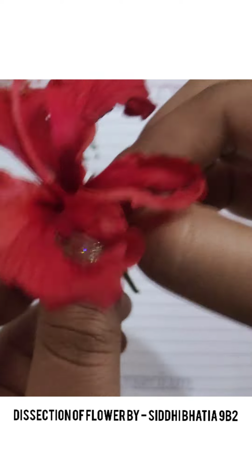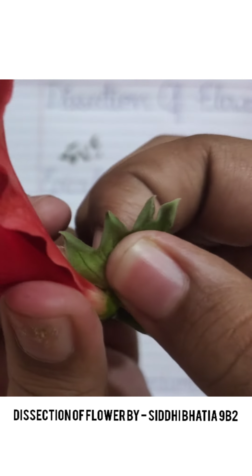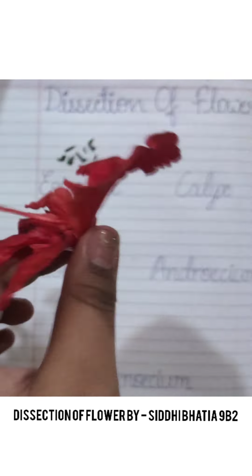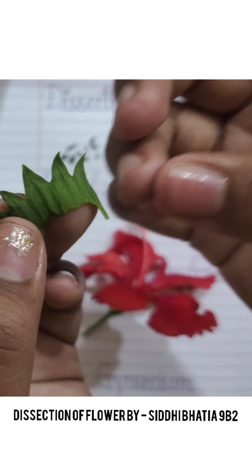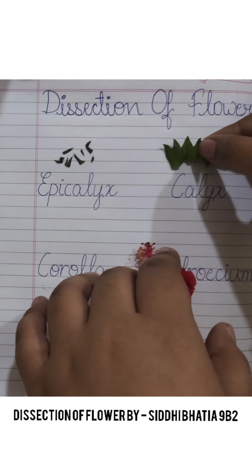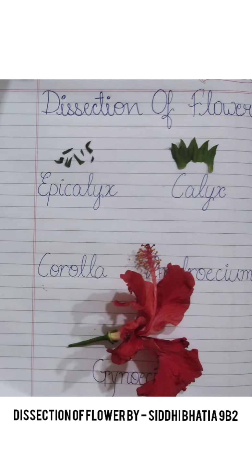Easily it is coming out from the flower. You can see these are sepals and there are 5 sepals. So you can see this is the first whorl of a flower.